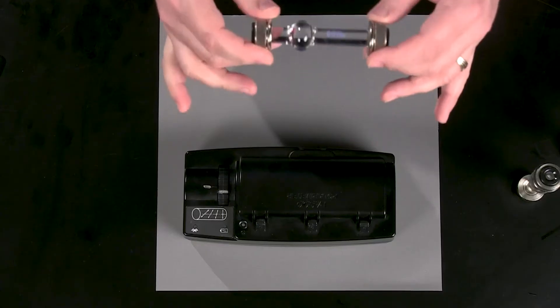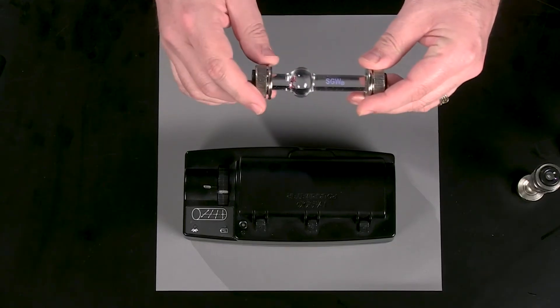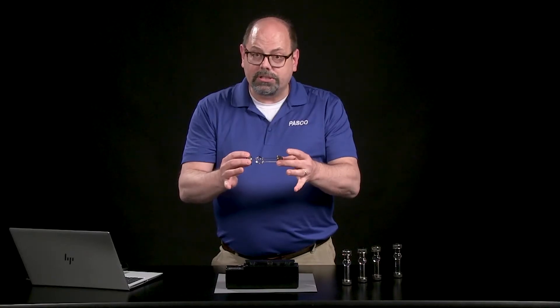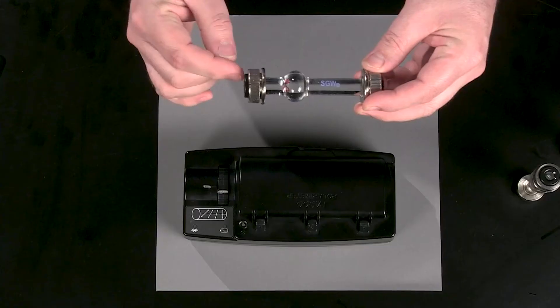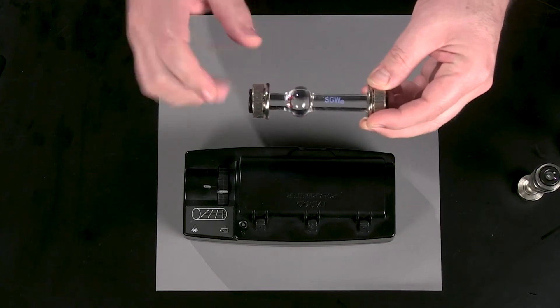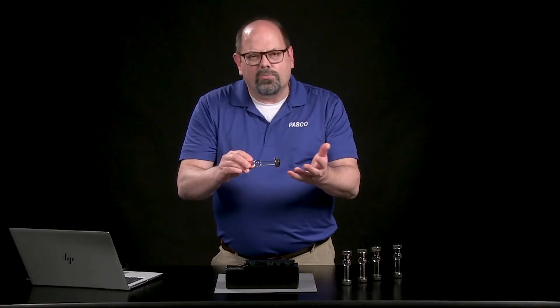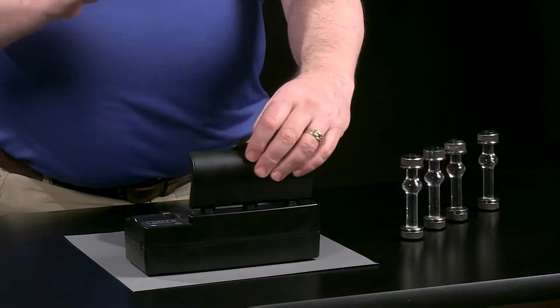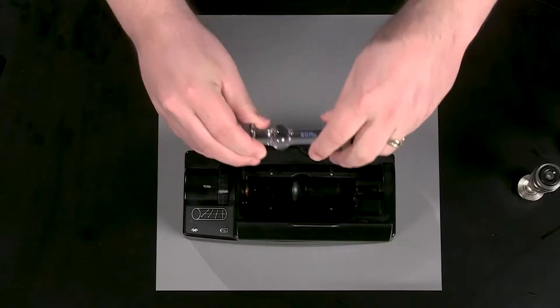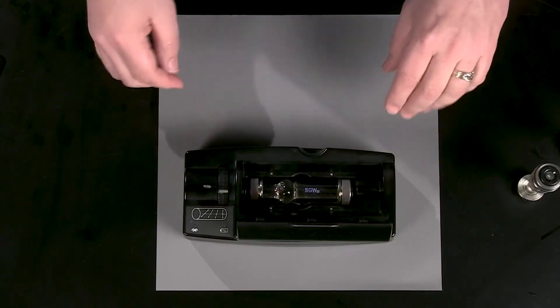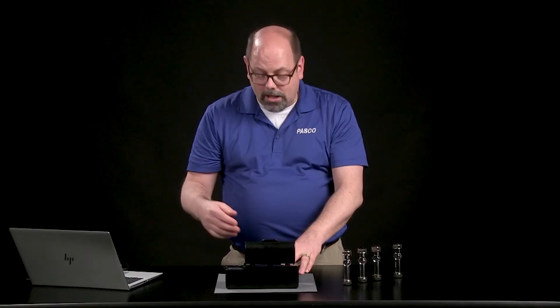How can we use that to determine how sweet a solution is just by the way it looks? We're going to take this polarimeter cell, which has a bulb in here. We're going to put solutions into the cell, but if you leave a little bubble, you can tip it so the bubble comes into the cell. This is water, not a solution, but I'm going to put that in first so we know where light is normally without having to worry about other molecules.